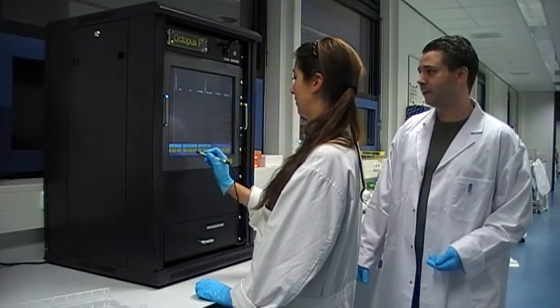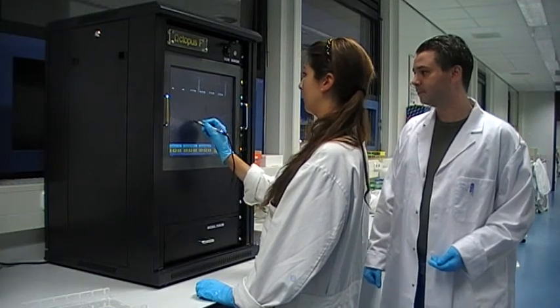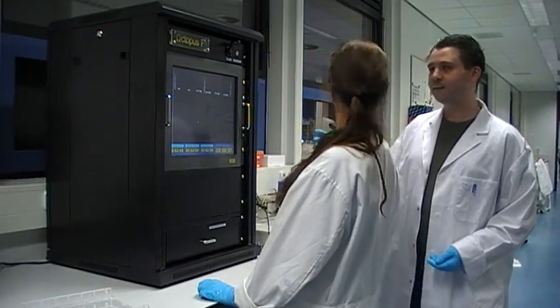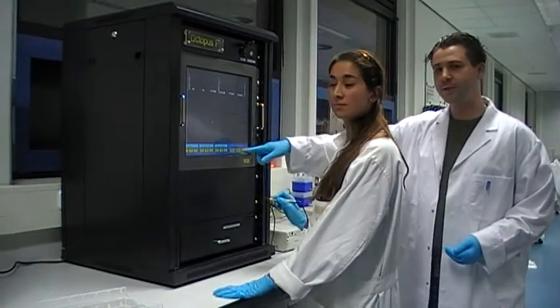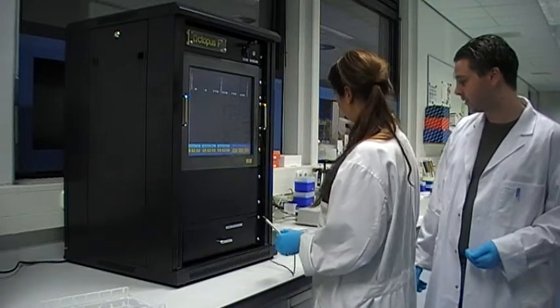Then you select the desired zoom factor. Once you've selected the portion you want to print, you simply press print on the display. And the print comes out that easy.